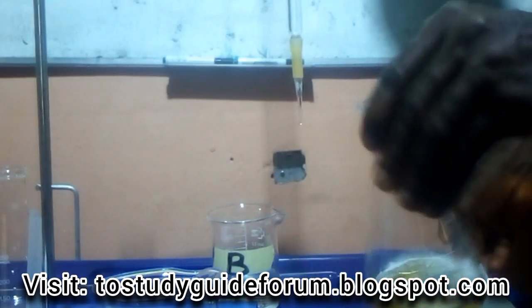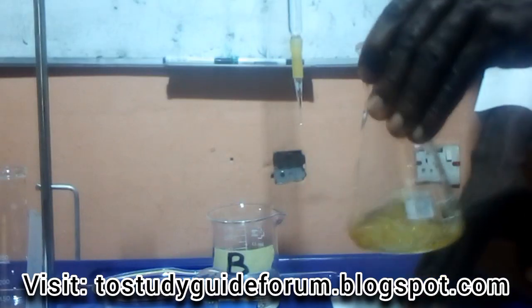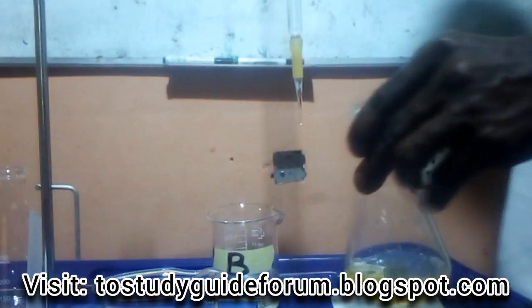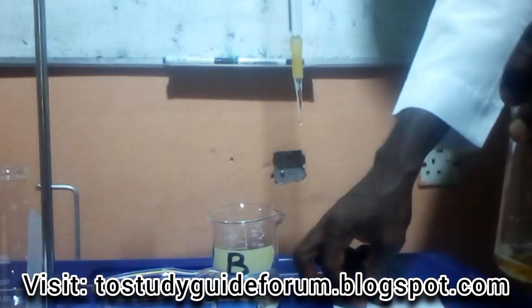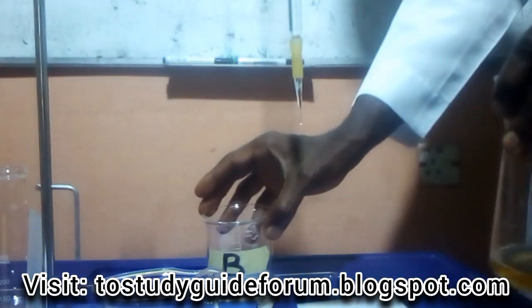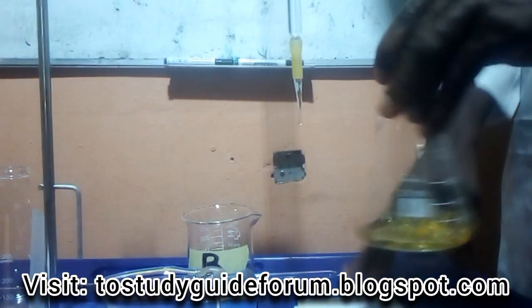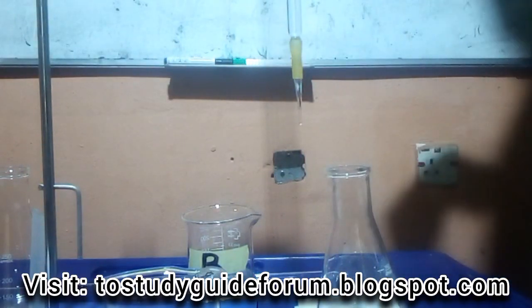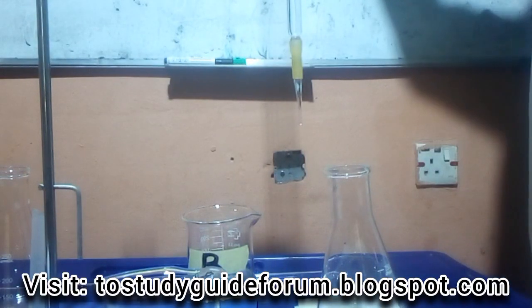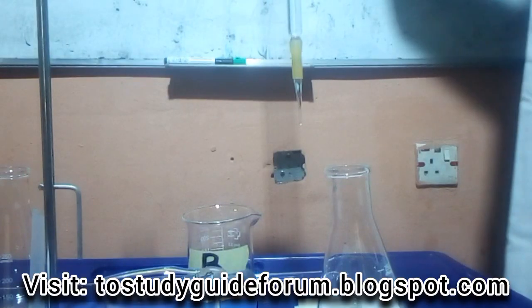Then I shake. You can see the color now, the yellow color. So now I'm going to titrate, and then I'll use my white background to watch when there will be the exact color change. Now I note my initial is 0.0. I started from 0.0.